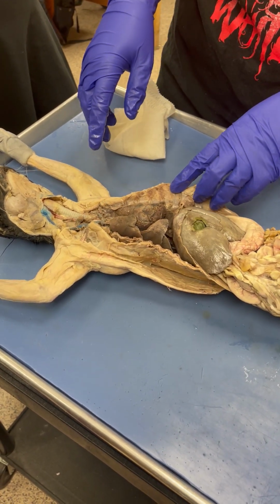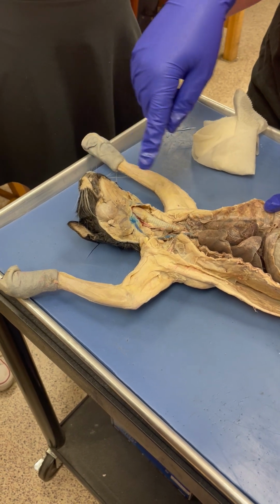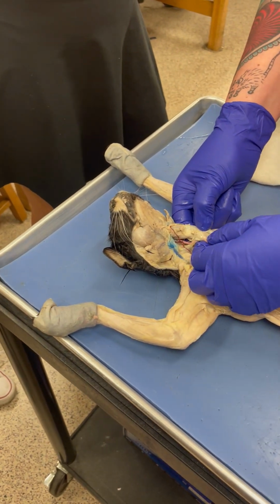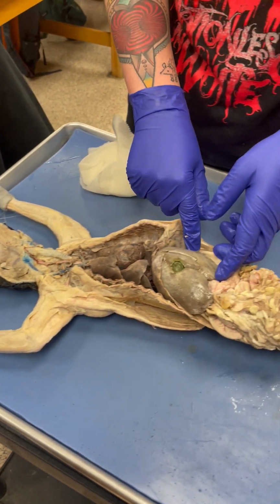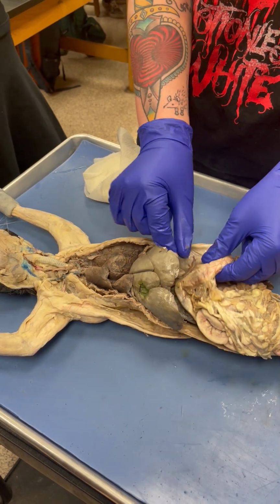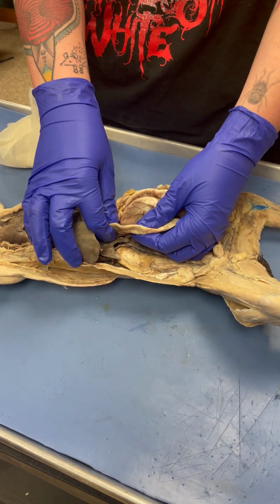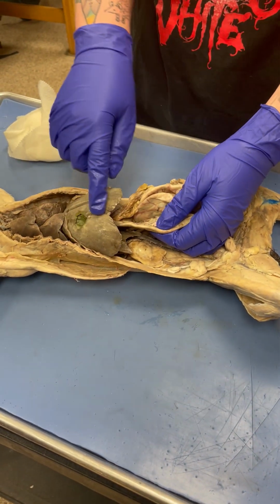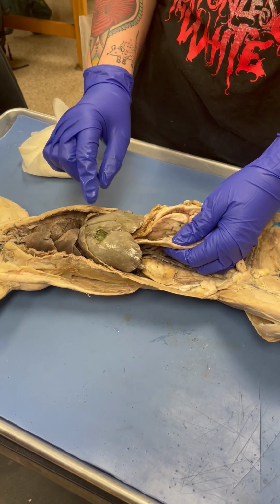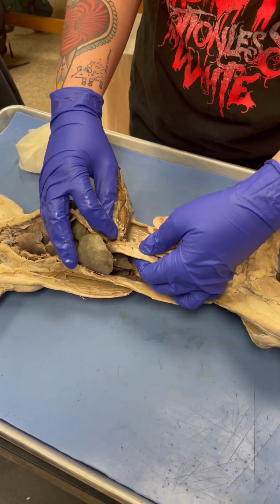What's the next system? Digestive. Digestive, you start at the oral cavity. What kind of digestion takes place there? Mechanical. Then you swallow, the food goes down the esophagus, which is that muscular tube directly behind the trachea. Goes down the esophagus into the stomach. What kind of digestion takes place in the stomach? Mechanical. Chemical, yes. Then it leaves the stomach, it enters the first part of the small intestine, the duodenum. Which organs are adding in fluids here? Liver. Yes, liver, gallbladder, and the pancreas, which is under the stomach and also tied to the duodenum there.